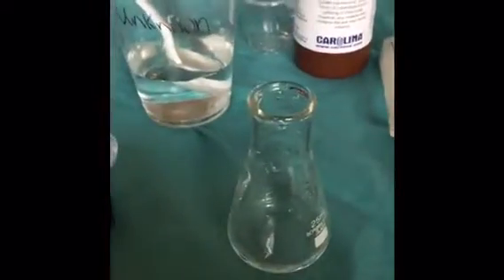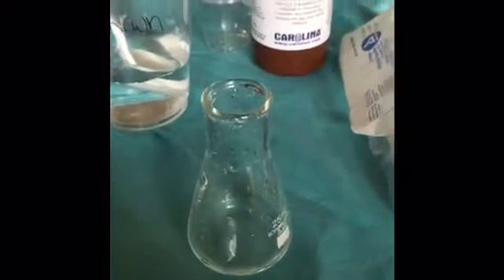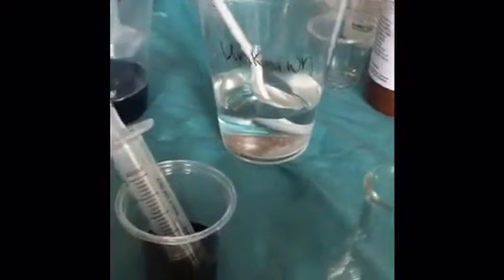So to make the 1 gram per liter sample of ascorbic acid, I added 1 milliliter of the ascorbic acid solution that I made previously to 1 milliliter of purified water. I'm now going to prepare the 1.5 grams per liter ascorbic acid sample with 1.5 milliliters of the ascorbic acid stock solution and 0.5 milliliters of pure water.